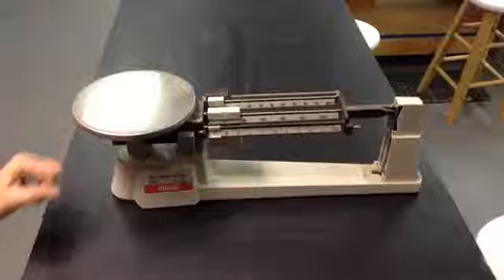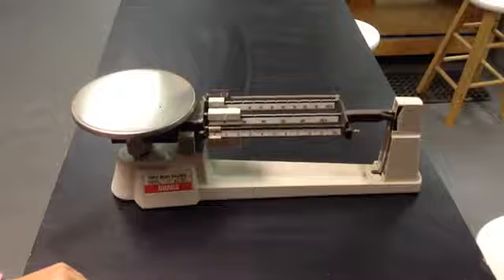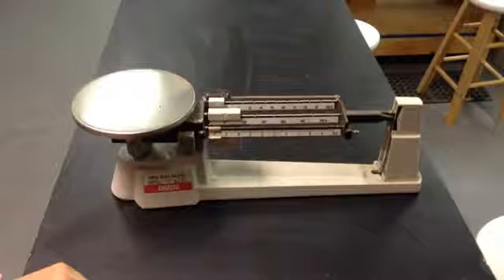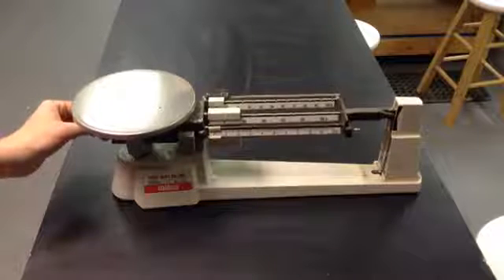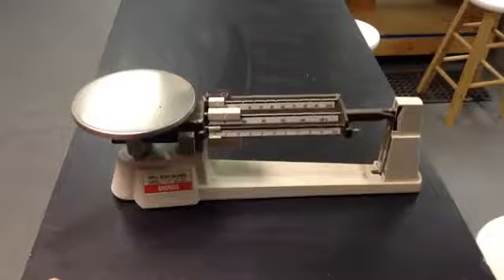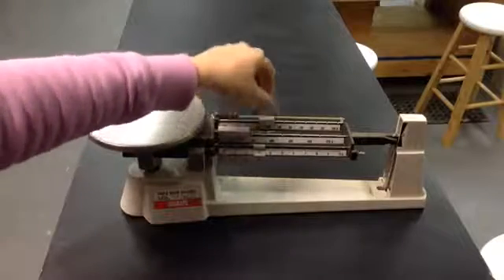knob on the end underneath the pan. It's a fine-tuning knob. Wait for the beam to stop moving, adjust more if necessary, and you want to make sure that the beam and the zero line up completely. When making ceramic glazes, often you need to use a container in order to measure your dry ingredients.